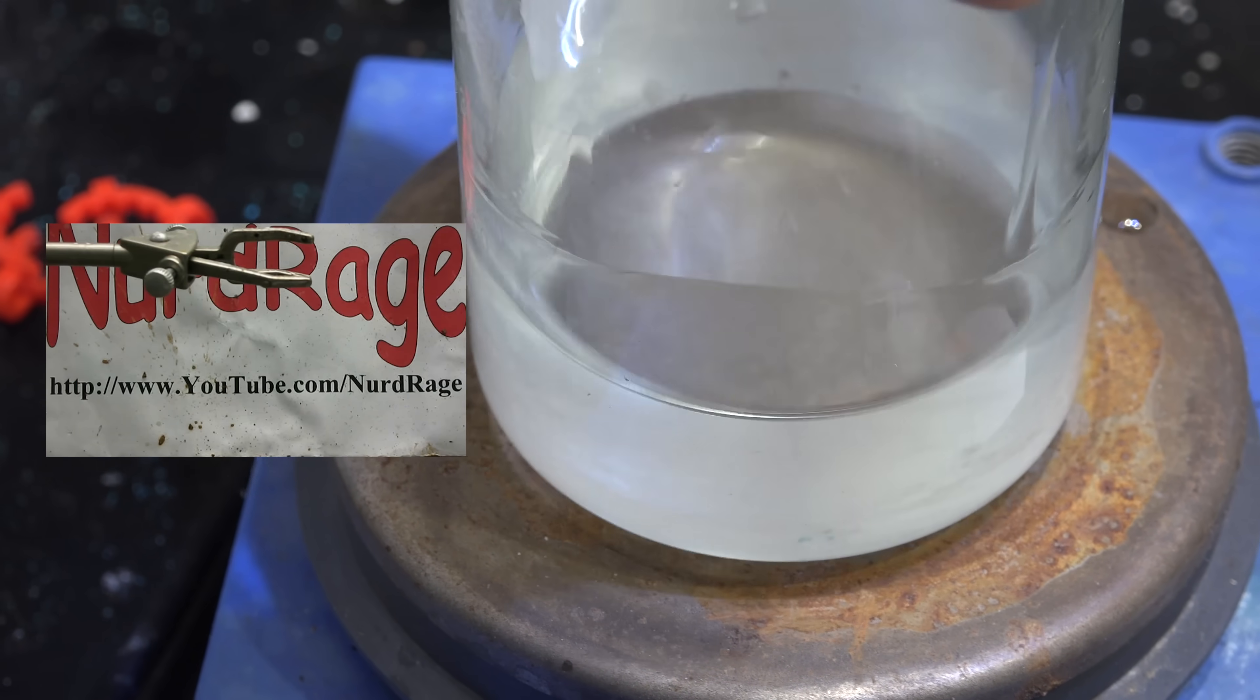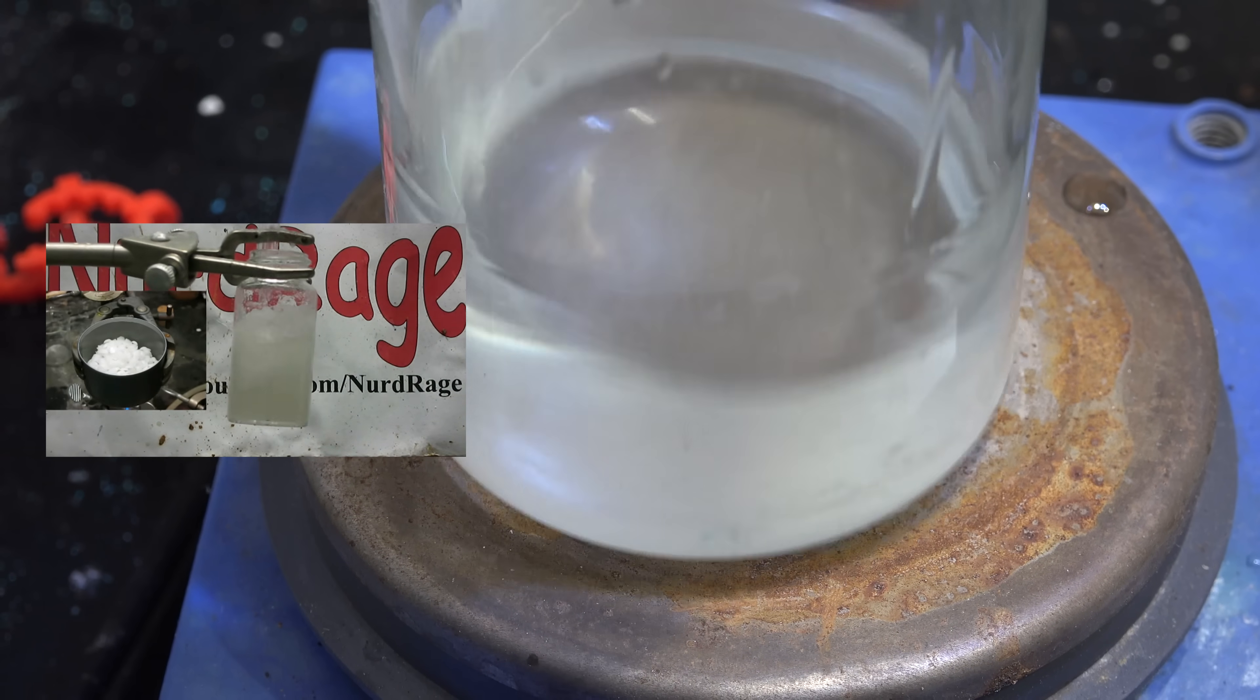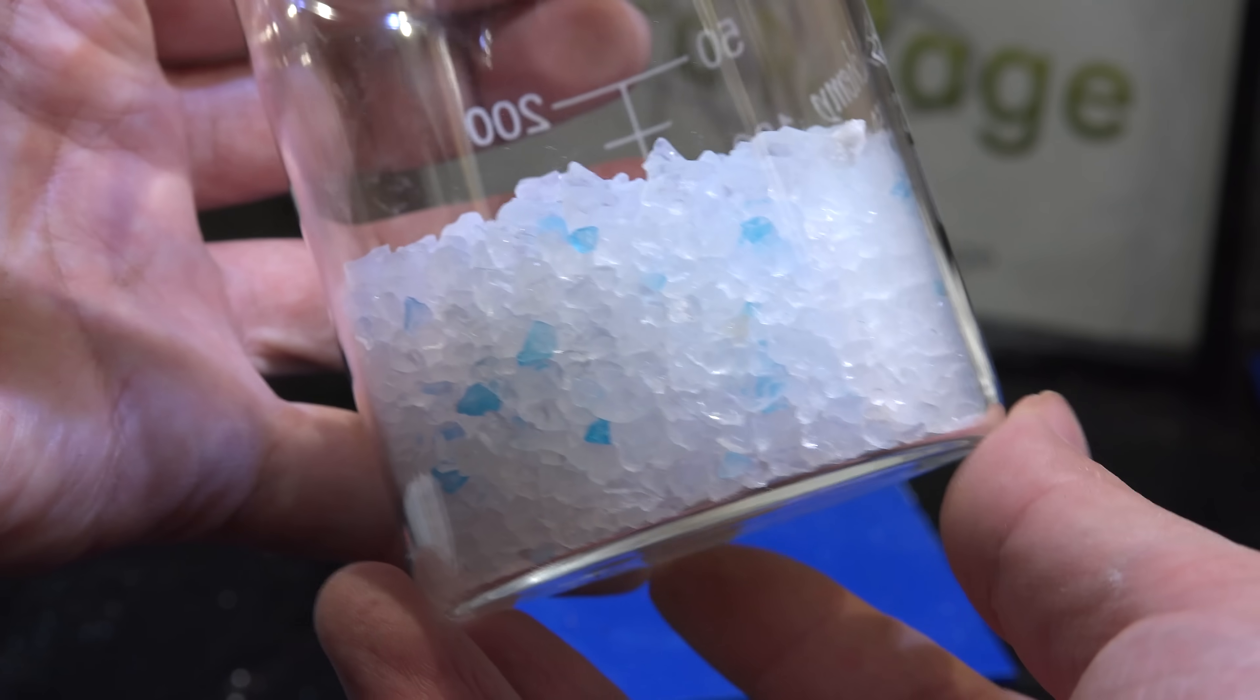Now I already did this many years ago using sodium hydroxide and silica gel from desiccant bags. But you need rather high temperatures to dissolve the silica gel desiccant. I have recently found something much better.